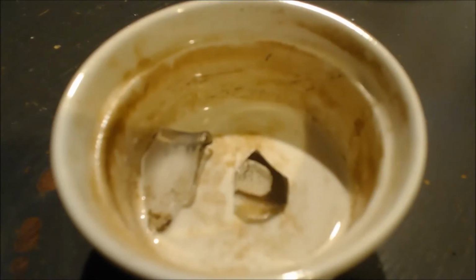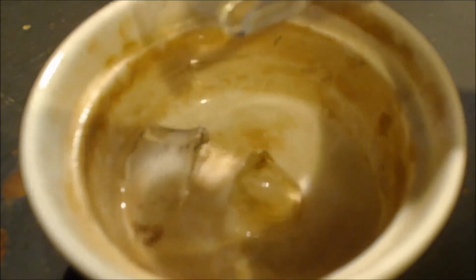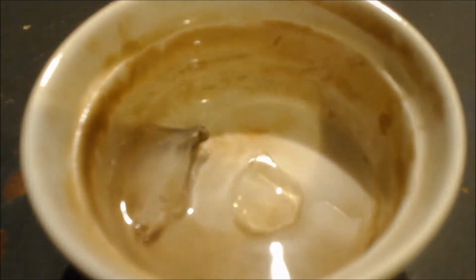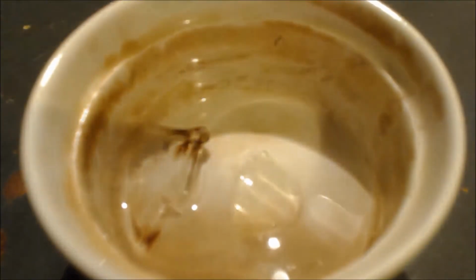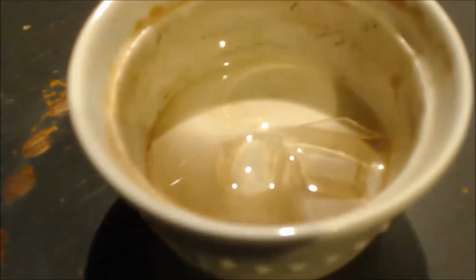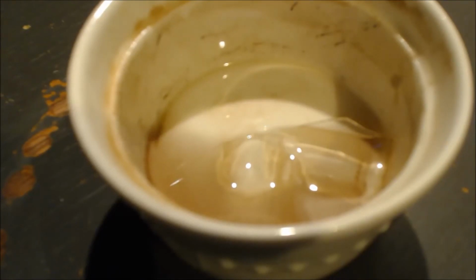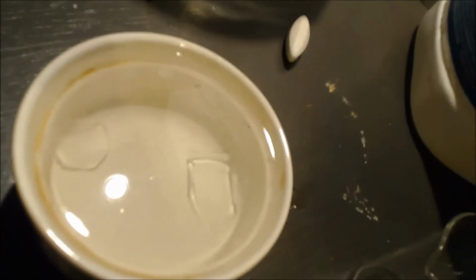You can see I got the MnO2 on the glass and in the container itself. Let's pour some hydrochloric acid on it. See how I took that away? It's all clear now. It's that simple. That's how you clean all your stuff. Just swirl it around and it'll go away in a second or two. I poured a whole bunch of extra water in there because I couldn't get the ridges. It wasn't hitting the ridges. But you can see how white it got everything.